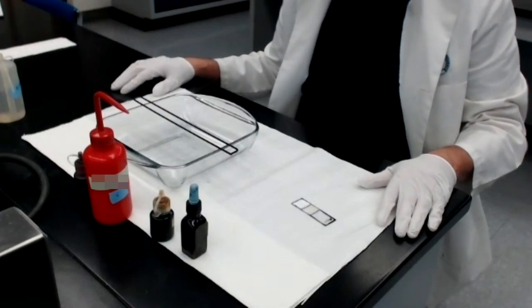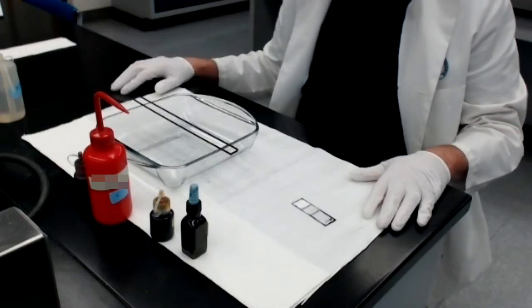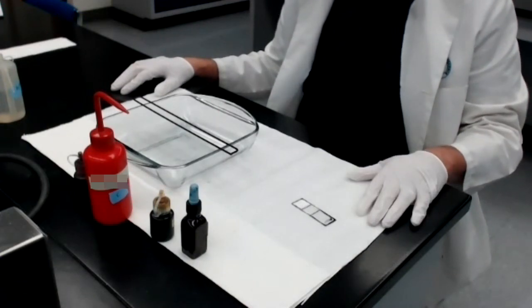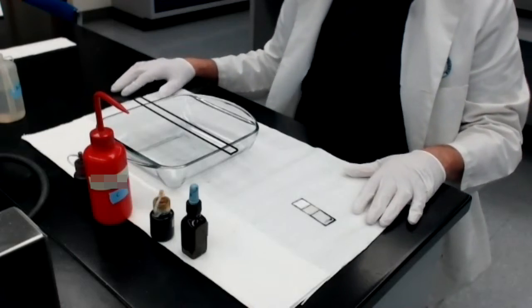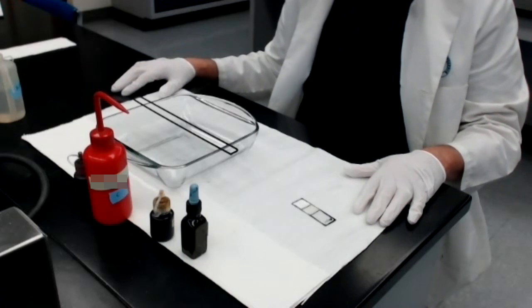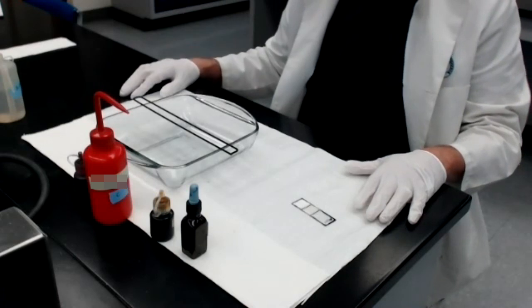As I mentioned in Module 5's video, there are several different stains that we're going to learn to do in this course. In Module 5, we learned to do a simple stain using methylene blue. In this module, Module 6, we're going to learn to do the Gram stain, arguably the most important microbiological stain being used today. It is probably done thousands of times every day in labs across the world.